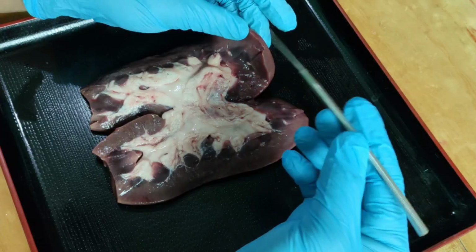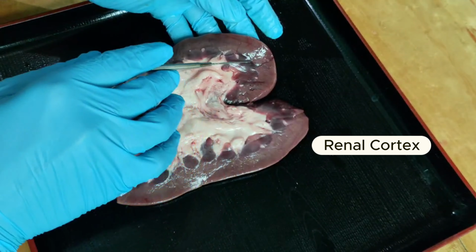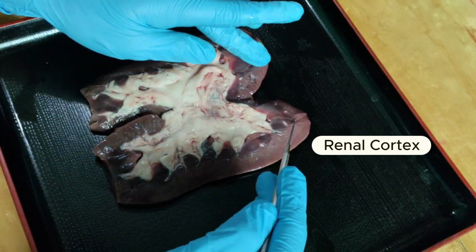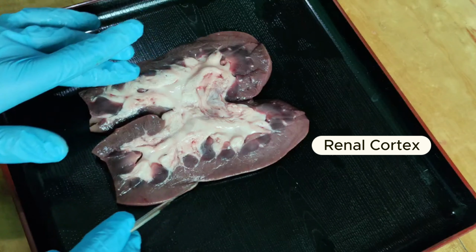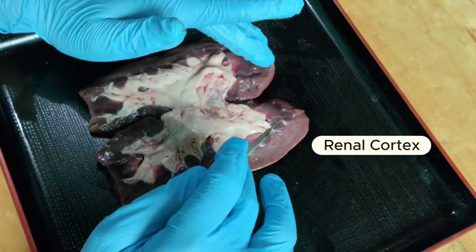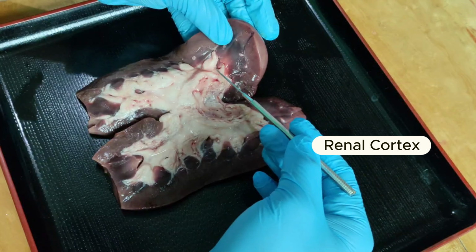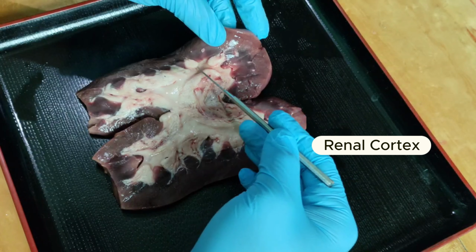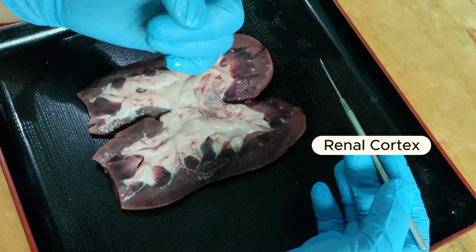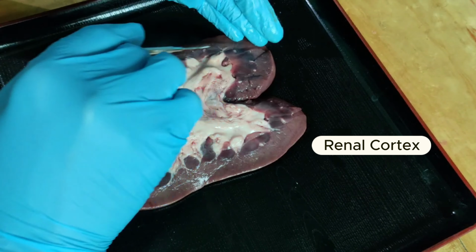The renal cortex is the outer region of the kidney. It is the solid looking outermost part here, and it contains many small arteries and veins that carry blood to and from approximately 1 million nephrons located in the cortex.